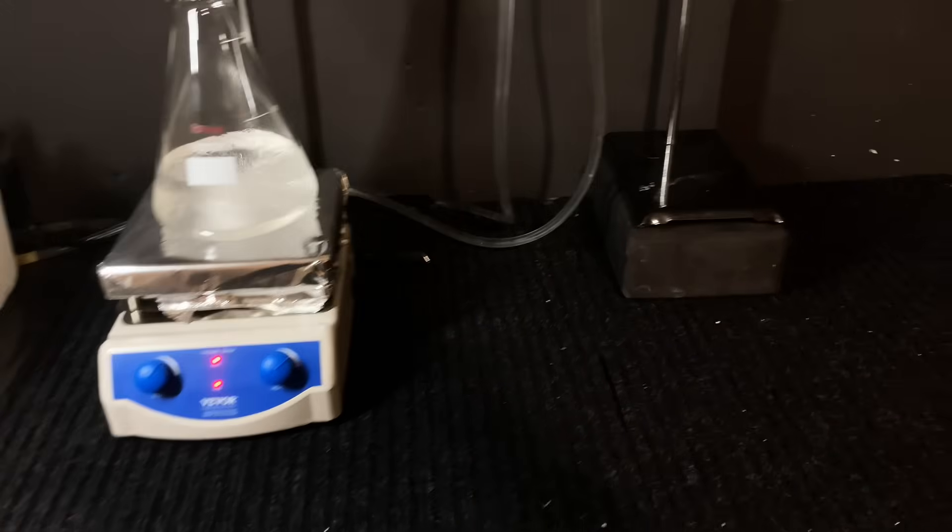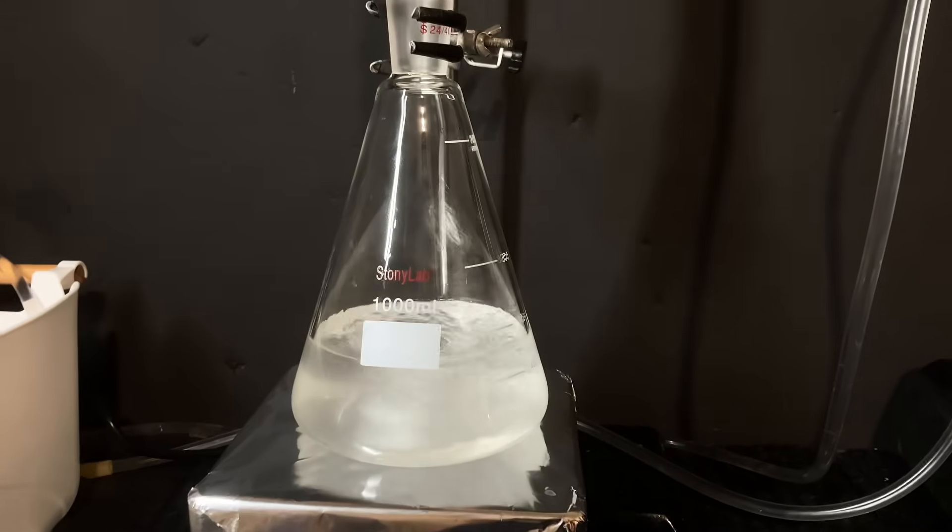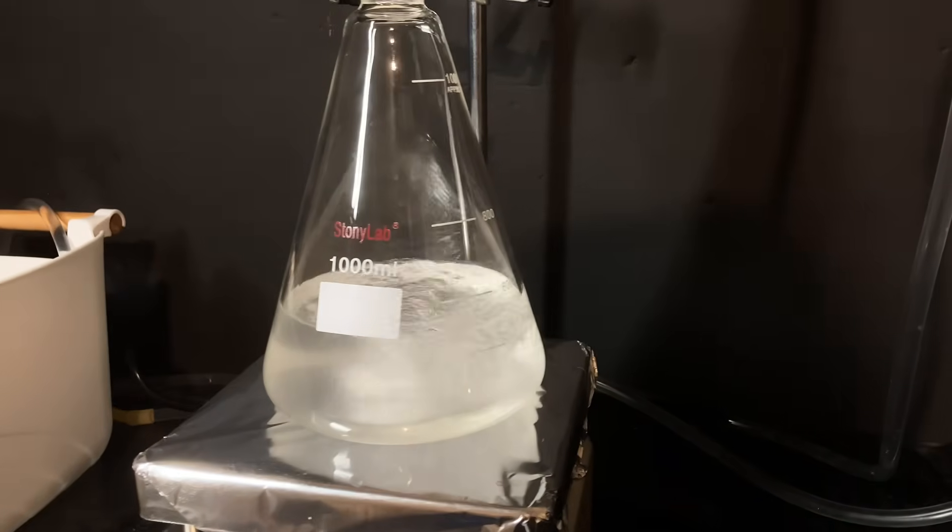When the first batch was done, you could see how the original cloudy ethanol that had some sieve dust in it is now crystal clear, and each batch of our pure anhydrous ethanol was transferred into this jug.